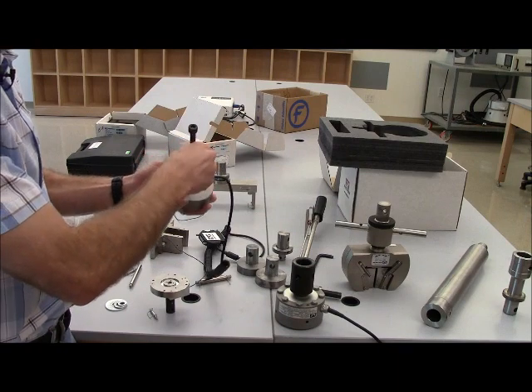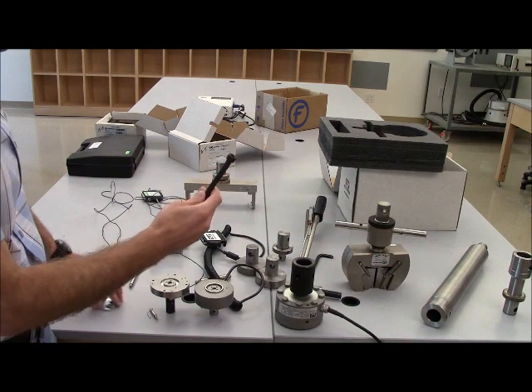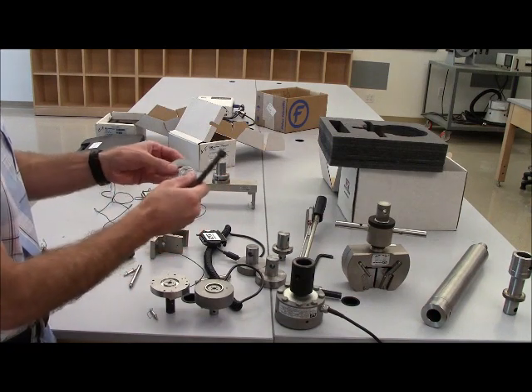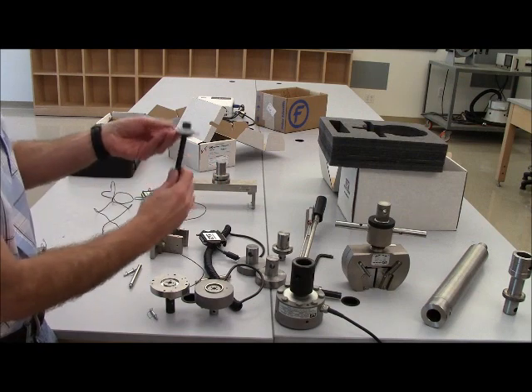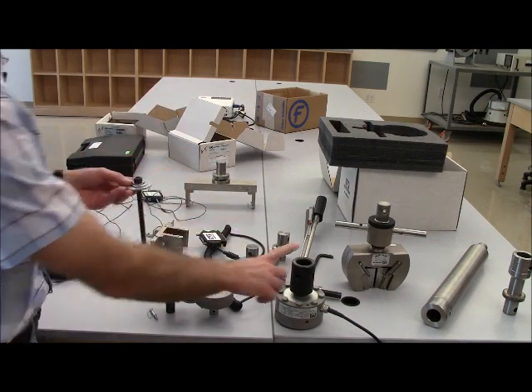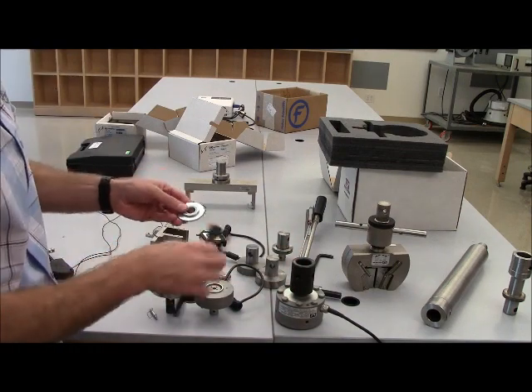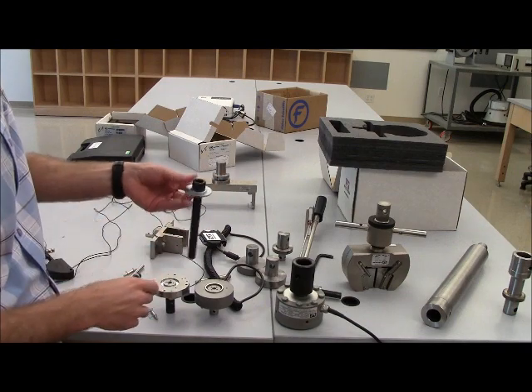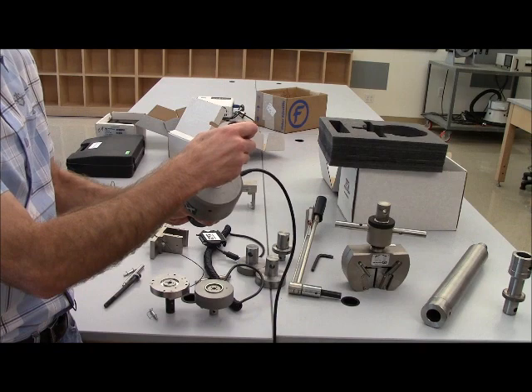When attaching the small load cells and using the small bolt, we have three washers that are used. And those three washers are used like this. When you are using the large load cell, we only have the two largest washers, the large bolt, and that is attached into the load cell.